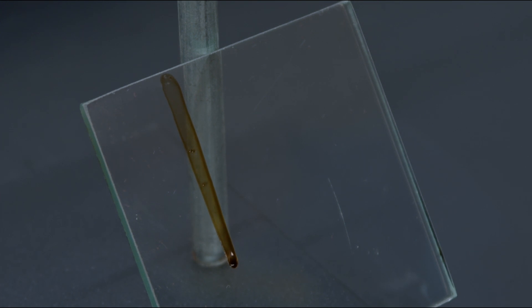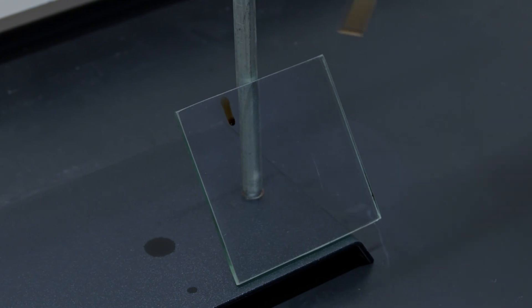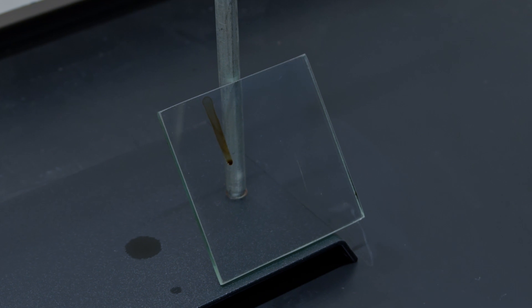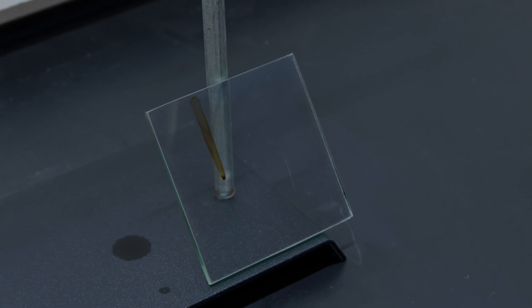If a dull, matted streak appears in the center of the path of the drop, report the test as positive. If the drop leaves a clear, glossy brown film without the dull, matted streak, report the test as negative.